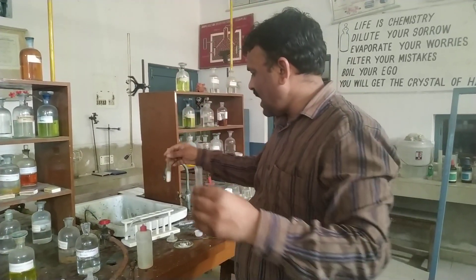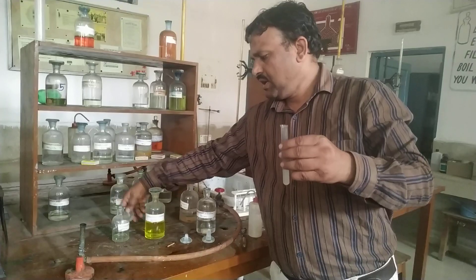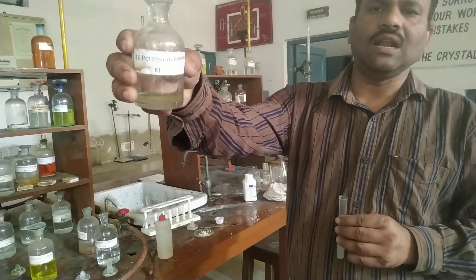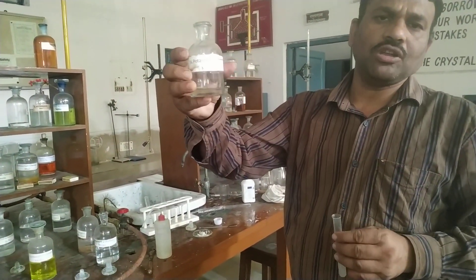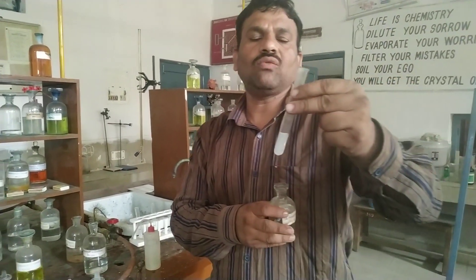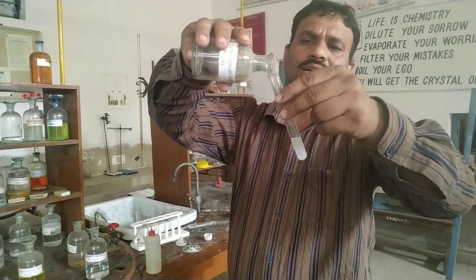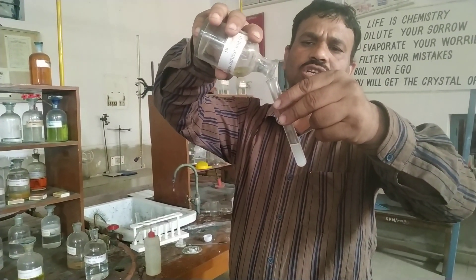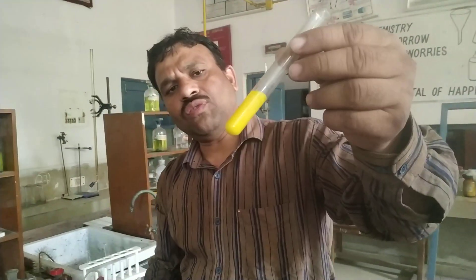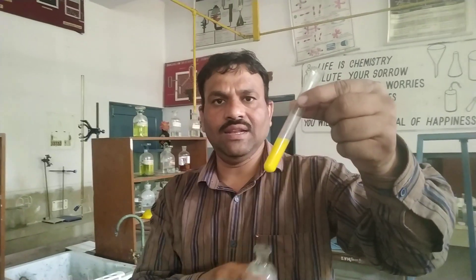In one part, we are adding potassium iodide solution. This potassium iodide is colorless. On addition of potassium iodide, if it forms a yellow precipitate, that will indicate the presence of lead ion. I am adding potassium iodide solution now — the formation of yellow precipitate indicates the presence of lead ion.